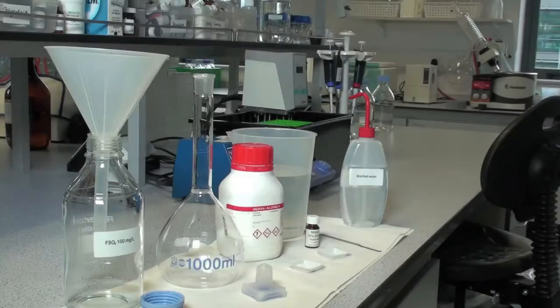For each batch of samples that are applied to the determination of Free Sulphite, either a single point Free Sulphite Standard or a Free Sulphite Calibration Curve must be performed concurrently using the same batch of reagents.